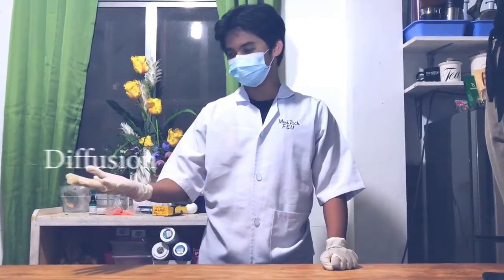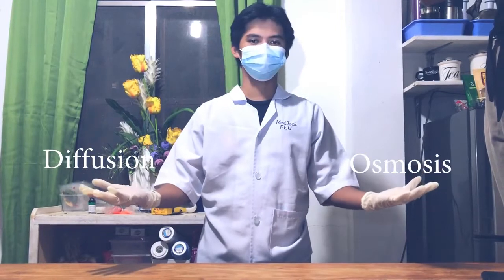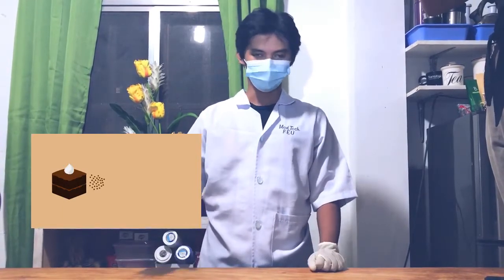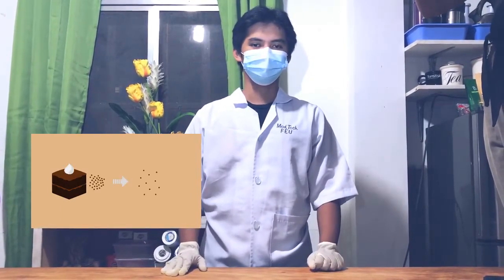Hi guys! Today, we're going to conduct experiments involving cell transport mechanisms, namely diffusion and osmosis. First on our list is diffusion. So what is diffusion? Diffusion is defined as the process resulting from the random motion of molecules by which there is a net flow of matter from a region of high concentration to a region of lower concentration.